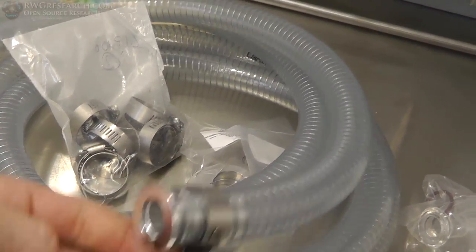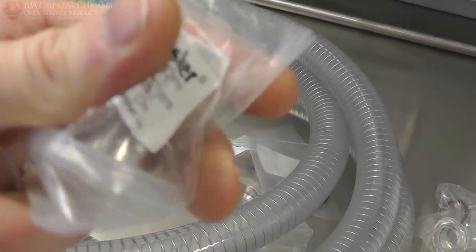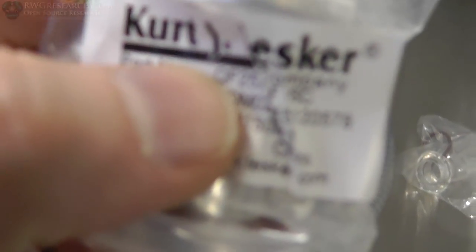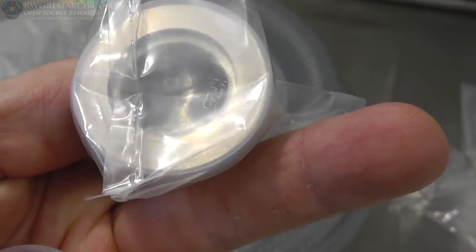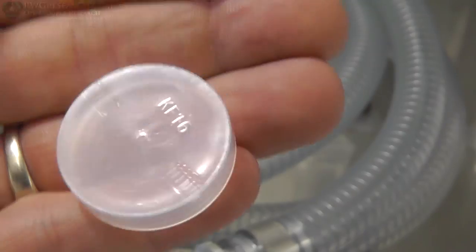All right, so I think the first thing I'm gonna do is actually work on the vacuum system and just get that done. So here's the vac line. This has this type of flange on it. I forgot what it's actually called. A KF flange. Focus there, focus. You can do it. So this is from Kurt J. Lesker. A KF25, that's this side. And then this side is a KF16.